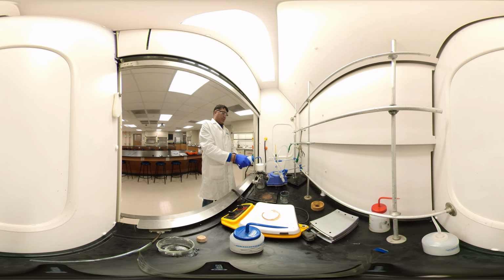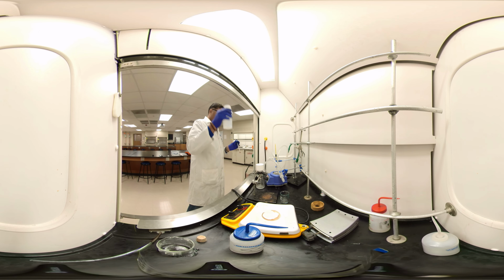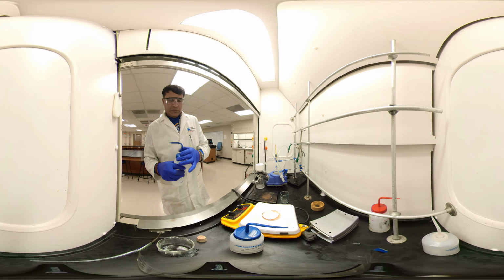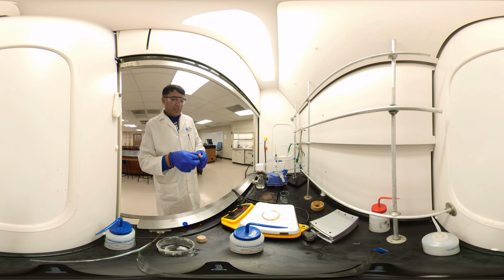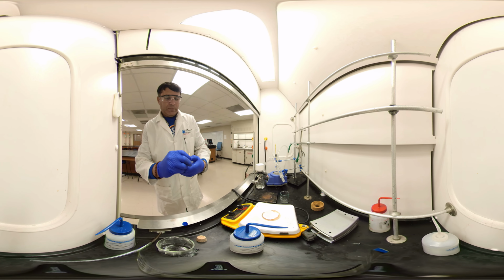I want to know if the wash is enough. I'll just pour a very little bit. If it's ice cold, it doesn't matter. You use the excess. I have the wash is enough. There is no more acid. I just want to confirm.